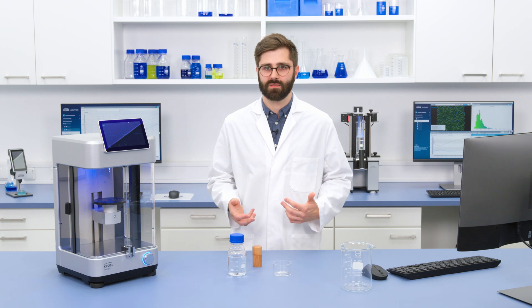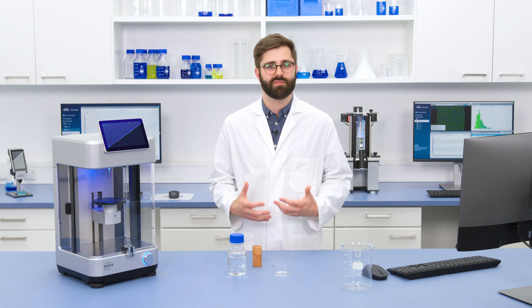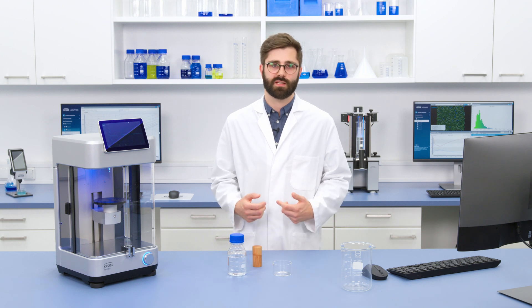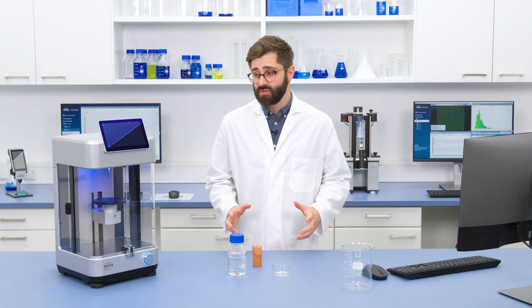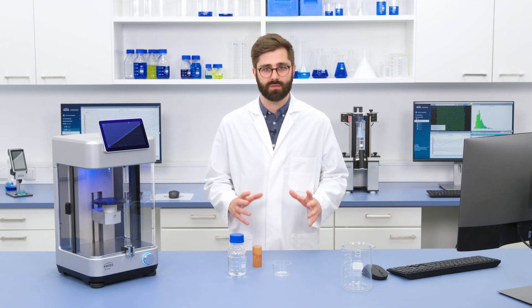This is trickier than it sounds because in truth there are dozens, maybe even hundreds, of different reasons why you would need to know the surface tension of a liquid. In short, surface tension is a fundamental property, just like viscosity or density, and it's critical for formulating any kind of liquid-based product like an ink, shampoo, lubricant, medication, or adhesive. Surface tension can also be used to determine fluid dynamic properties, like the volume of a drop falling from a nozzle.